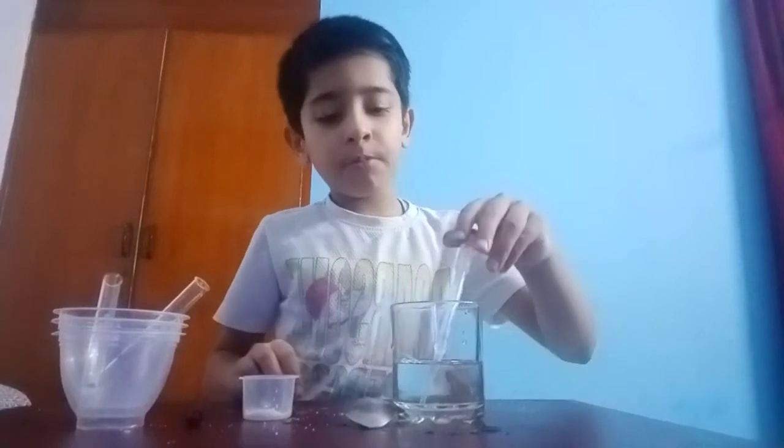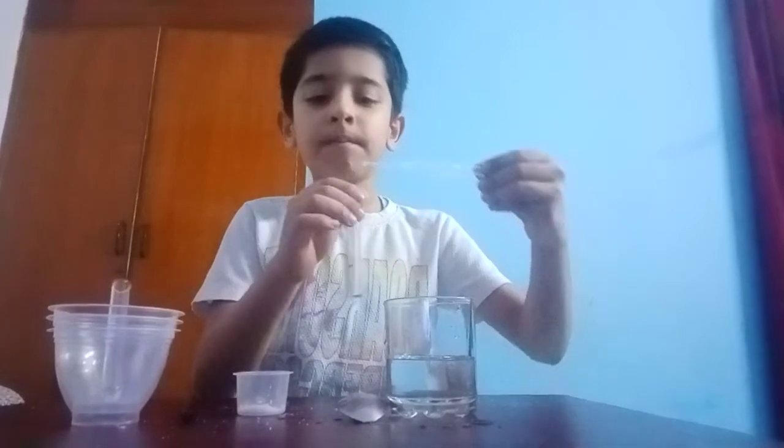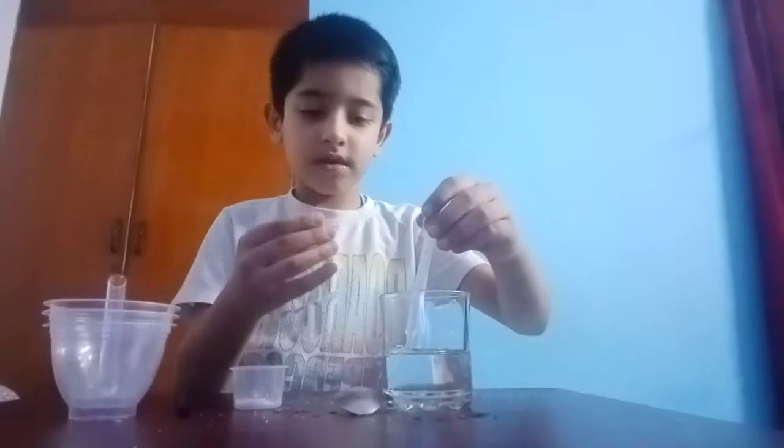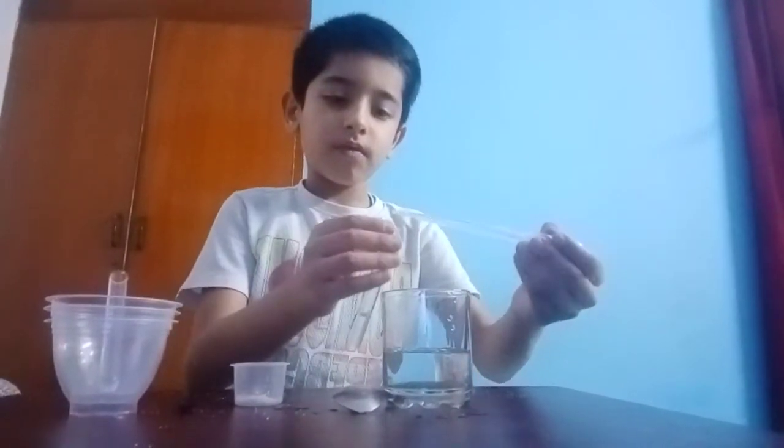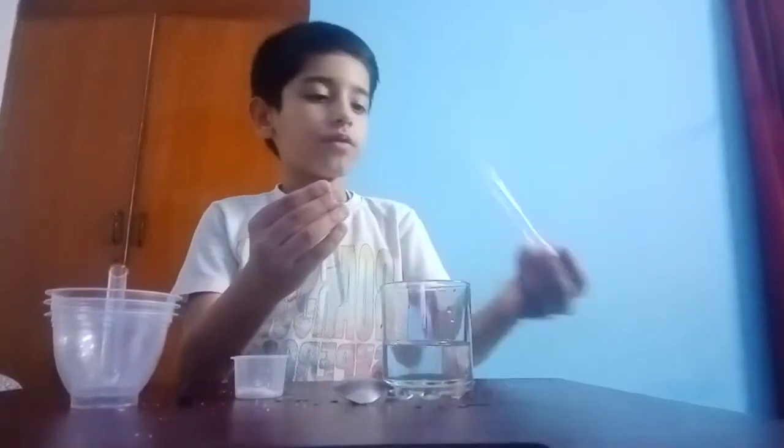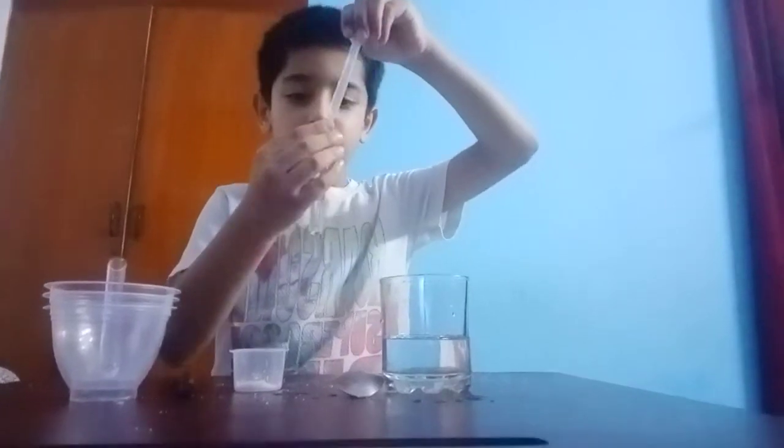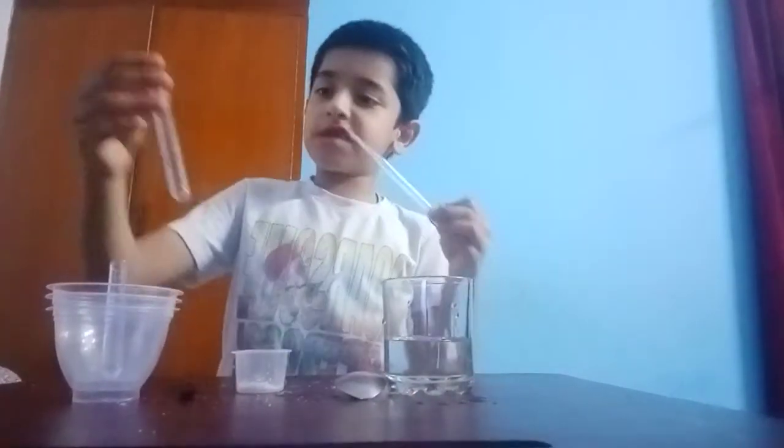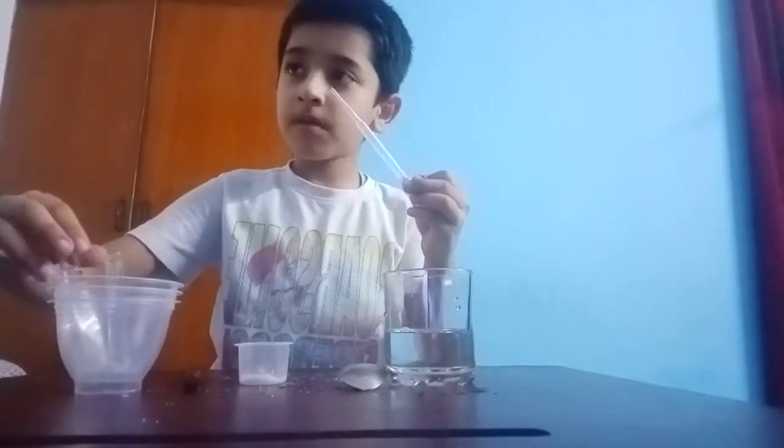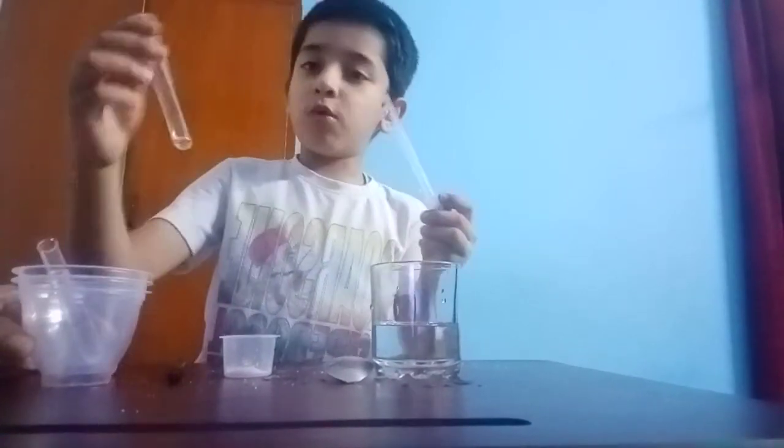First we will pour some water into the test tube with a pipette like this. This much, and remember you have to pour equal water in both.